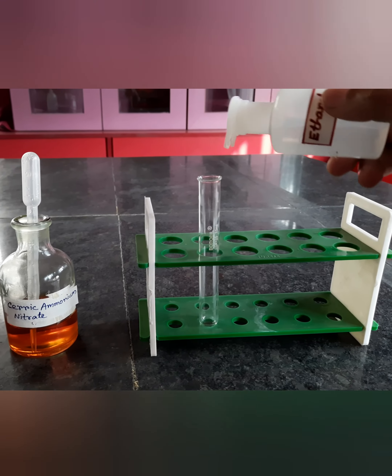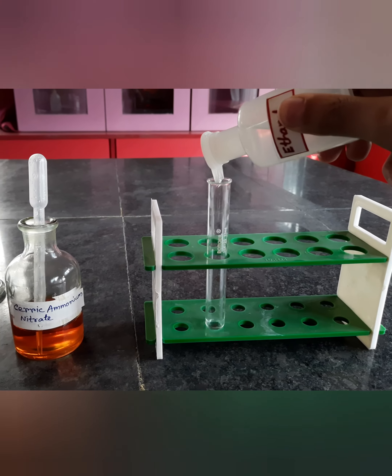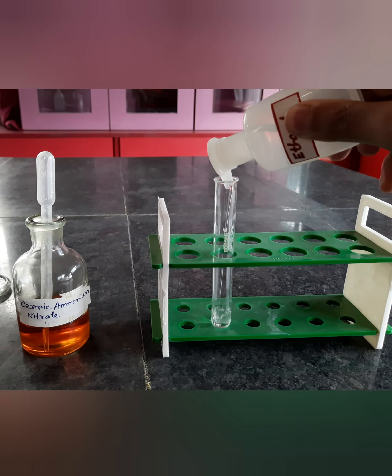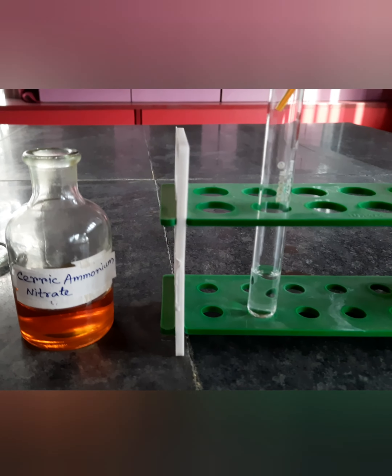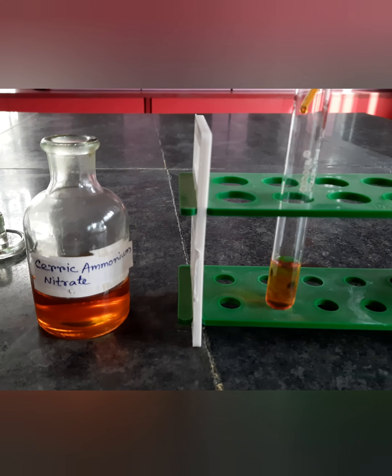First, in a clean, dry test tube, I have taken around 1 ml of test sample — for example, ethanol. Now, a few drops of ceric ammonium nitrate reagent is added, and I have shaken the solution well.